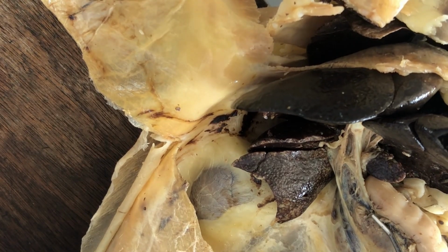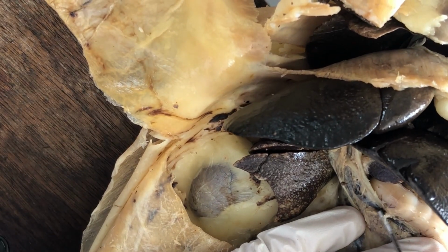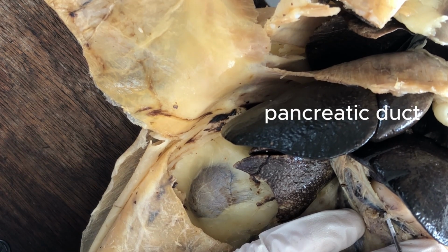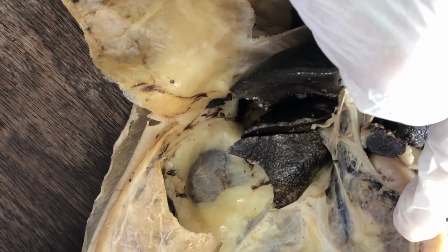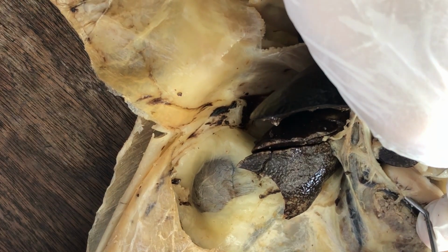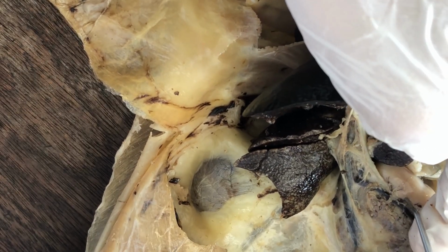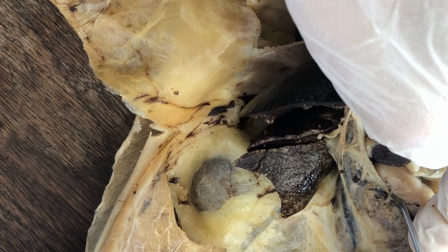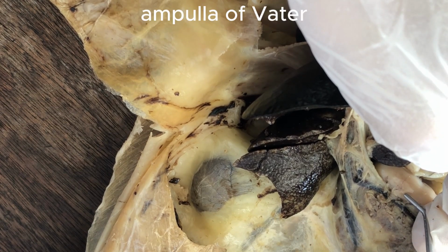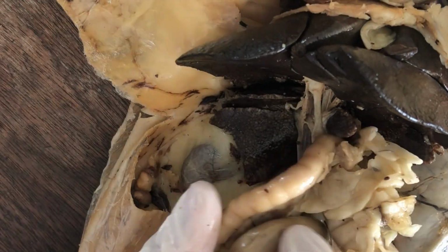And here's the pancreas. I've dissected it enough to reveal one of its ducts here. That's the pancreatic duct containing the pancreatic enzyme secretions. So the common bile duct intersects with the pancreatic duct just before they enter the duodenum. And where they enter the duodenum, there's a slight bulge. That bulge in the duodenal wall, where the common bile duct and pancreatic duct enter, is called the ampulla of Vater. Ampulla of Vater. That's the site where they empty their secretions into the duodenum.